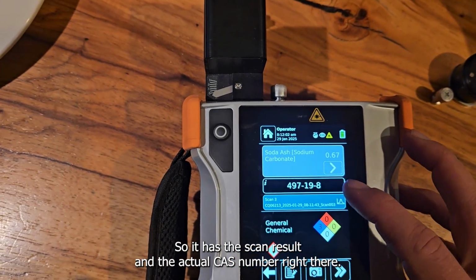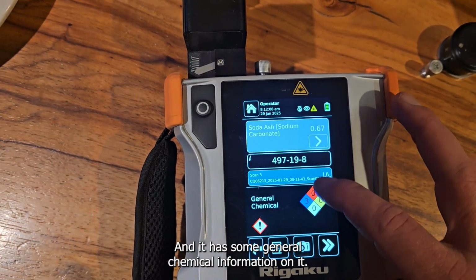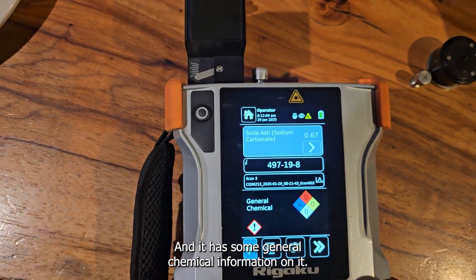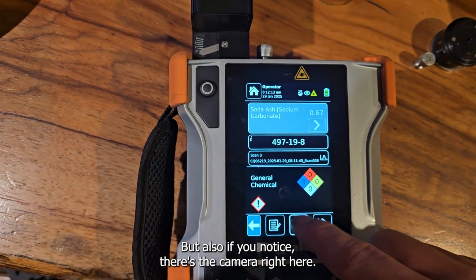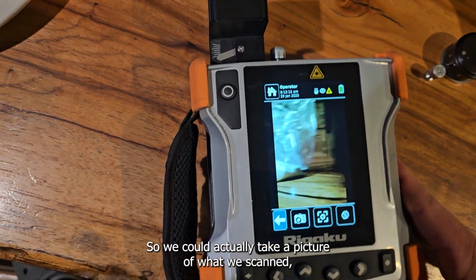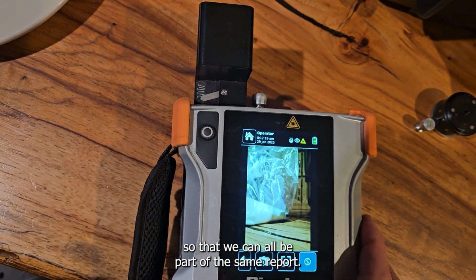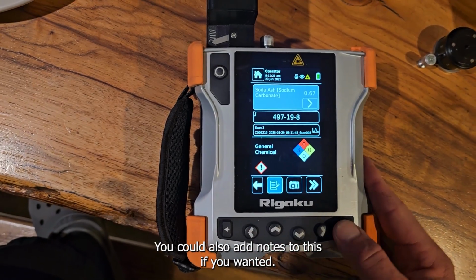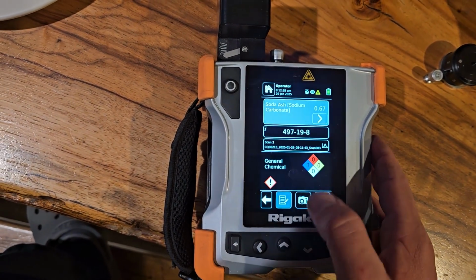So it has the scan result and the actual CAS number right there, and it has some general chemical information on it. It actually won't show you anything else on this, but also if you notice there's the camera right here, so we could actually take a picture of what we scanned, so that way it can all be part of the same report. You could also add notes to this if you wanted. I'm not going to add any notes, but that is also another feature.